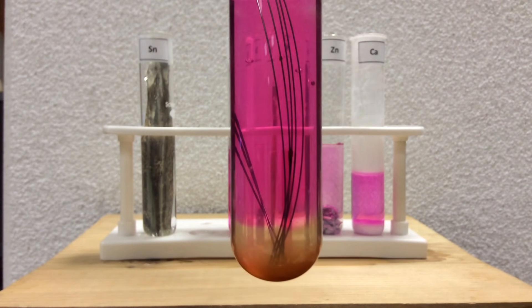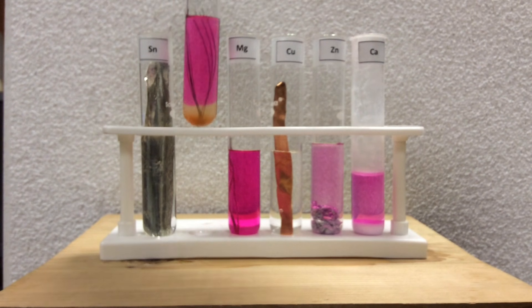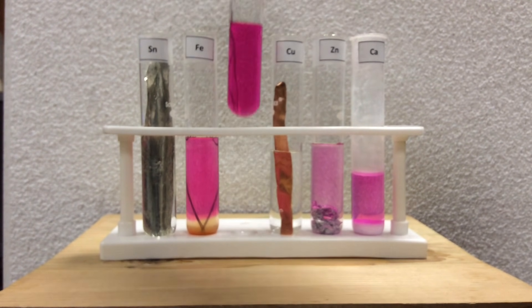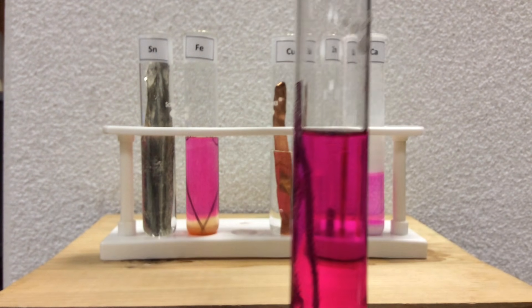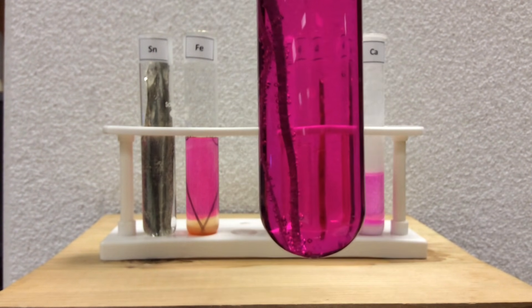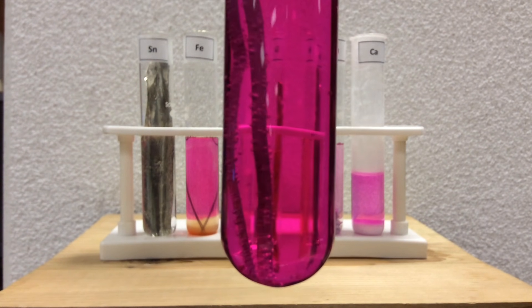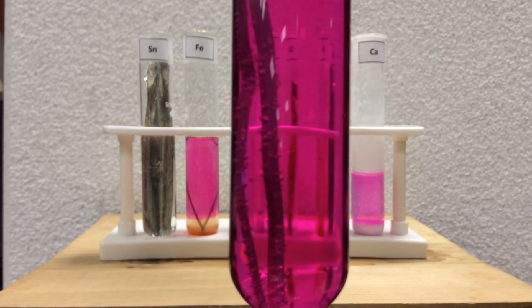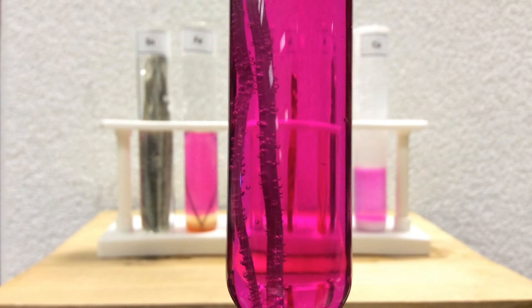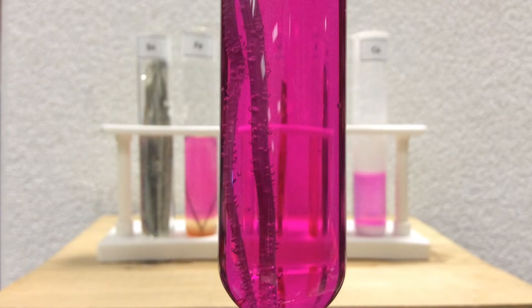And with the acid tests, you should be able to figure out who is the most or rank these metals in terms of their reactivity. Magnesium, again, as we talked about, we saw the red color immediately afterwards. And now we see some bubbles still sitting there. That's hydrogen gas and the pink color. Plenty of magnesium oxide being made as this reaction was pretty vigorous, even in water.